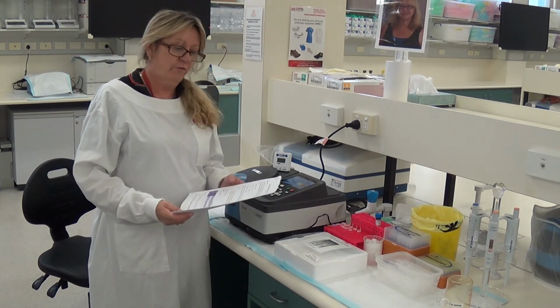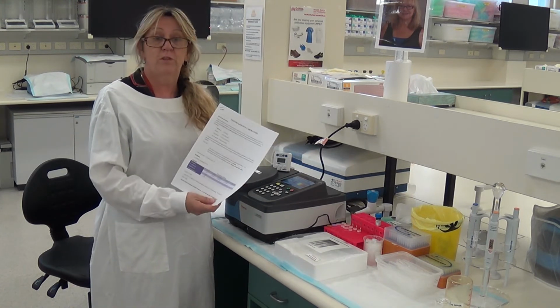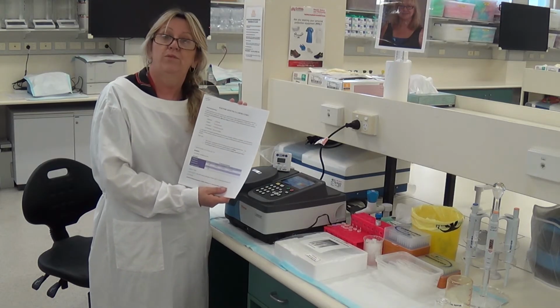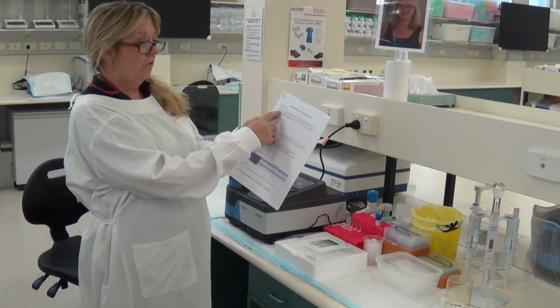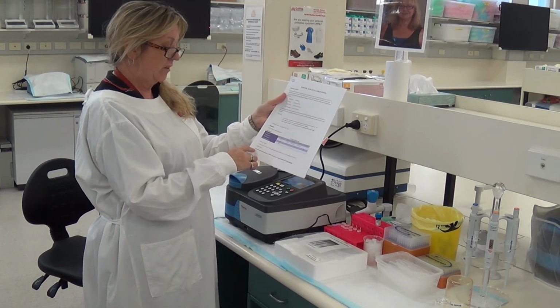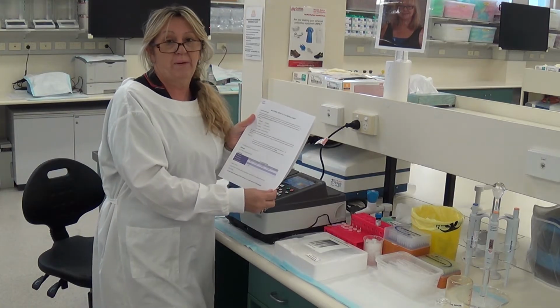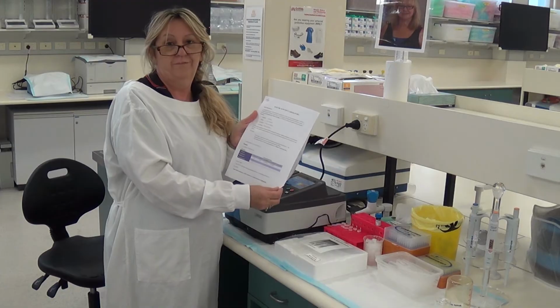So I've uploaded for you this enzyme kinetics laboratory document, okay? For you to be doing this lab, I want you to print out a copy of this and keep it with you so you can go through it as I do the lab. So you can see here, it just gives you a brief introduction, it tells you what's here, the concentrations, it tells you what's in the assay mix, and it tells you about the enzyme. So as we go, I'm going to point you to the pages that you need to turn to so that you can fill in this document as we go.